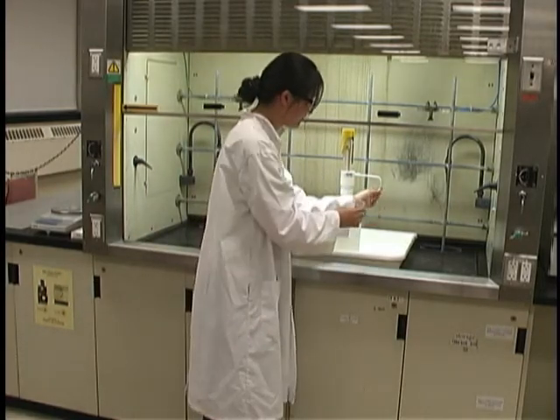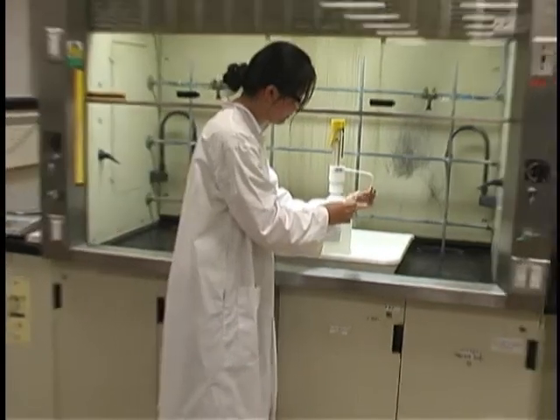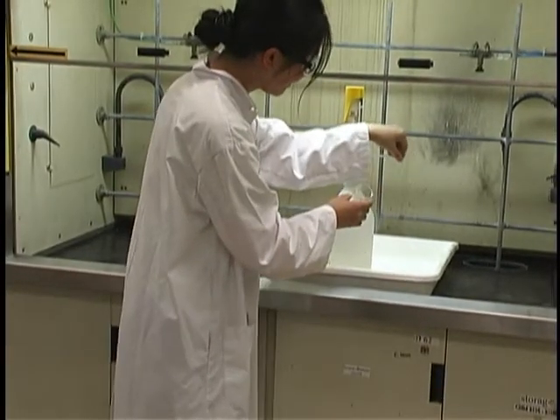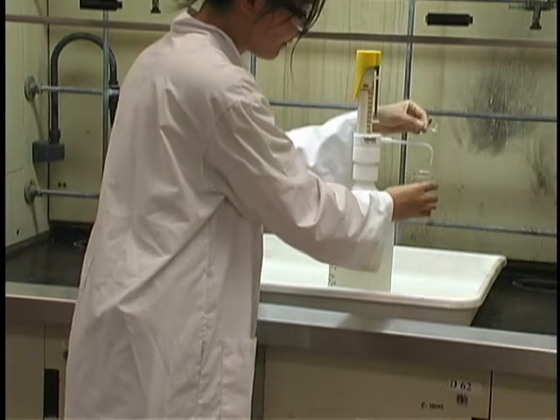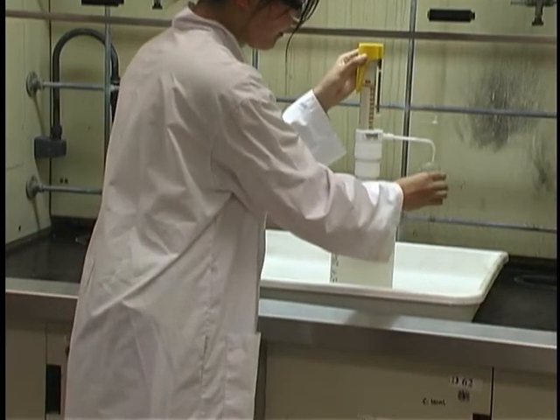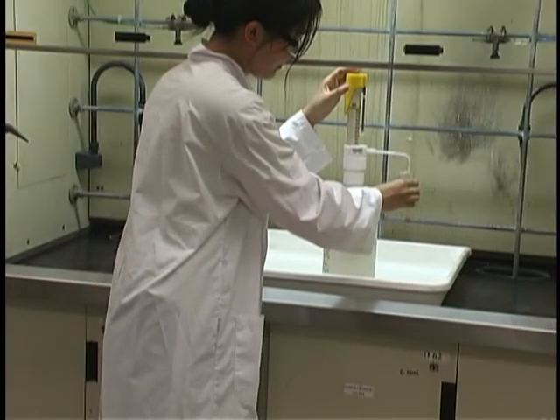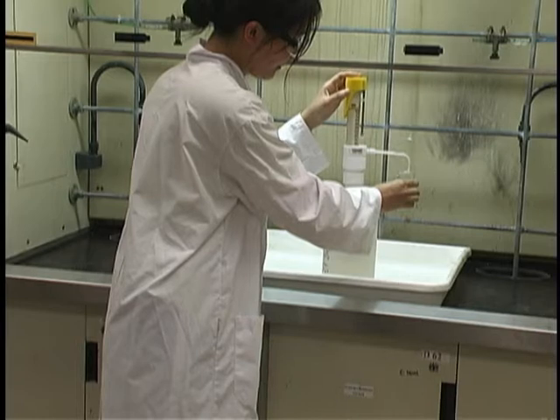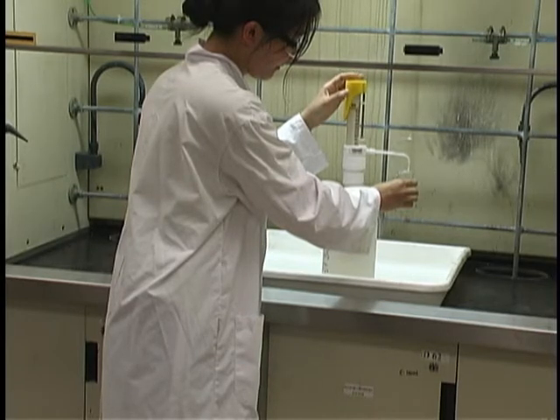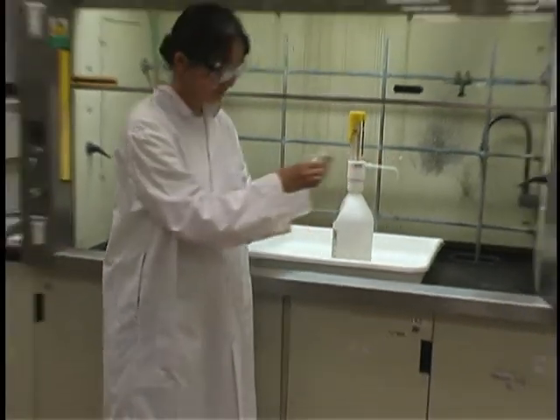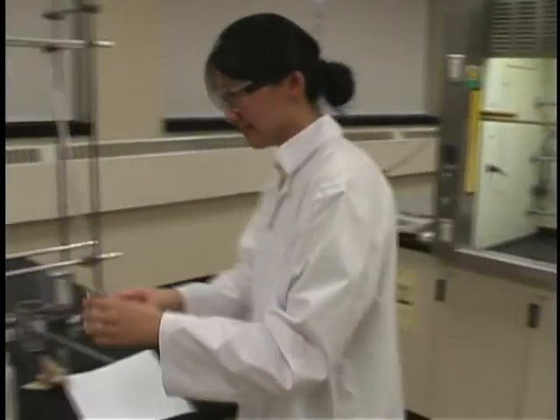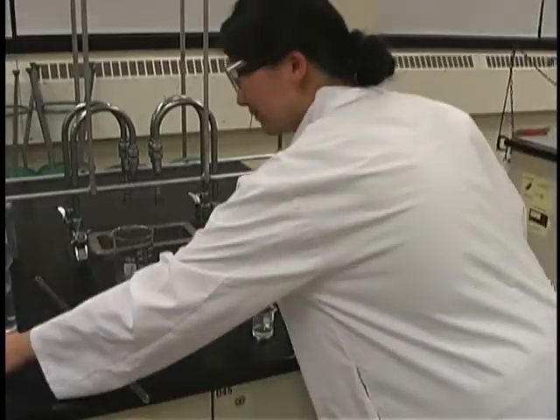Use a 50 milliliter graduated cylinder to obtain approximately 10 milliliters of concentrated 12 molar HCl from the pump. If the pump has a cap on it, be sure to remove the cap before using the pump. Pull the pump up and just allow the liquid to flow out. Come back to your desk and measure the volume of the acid using a graduated cylinder.